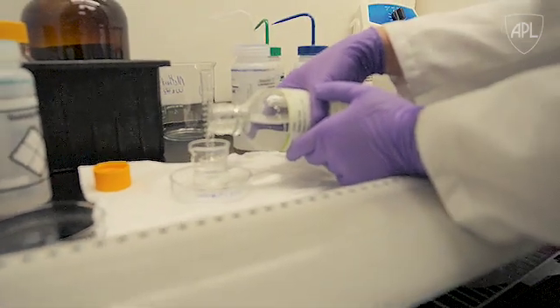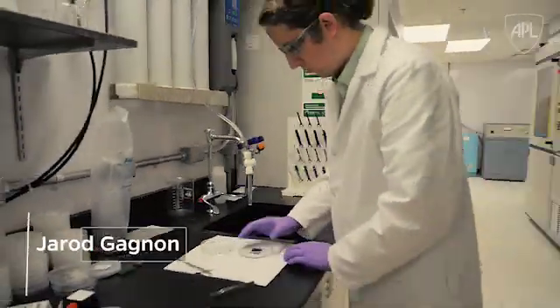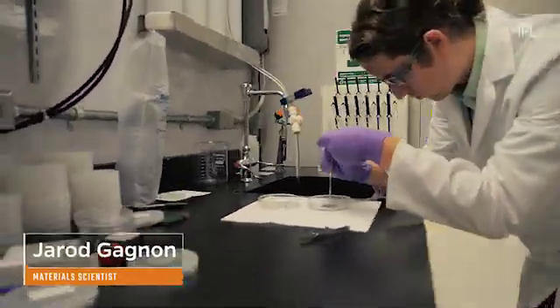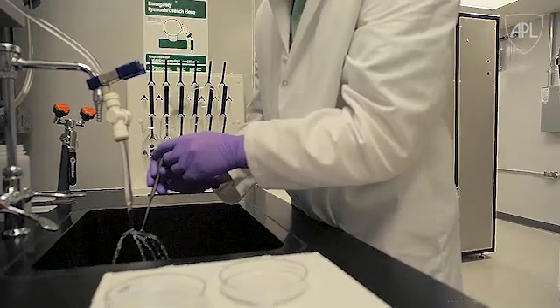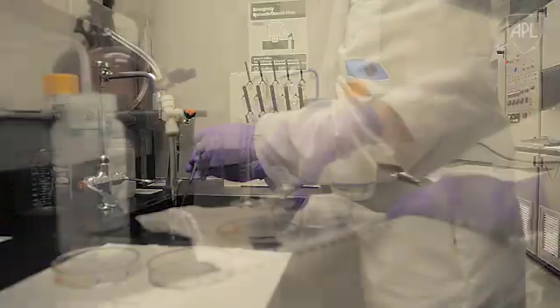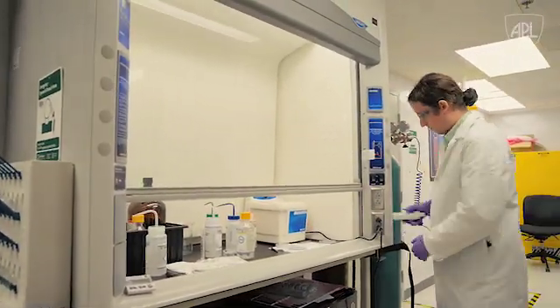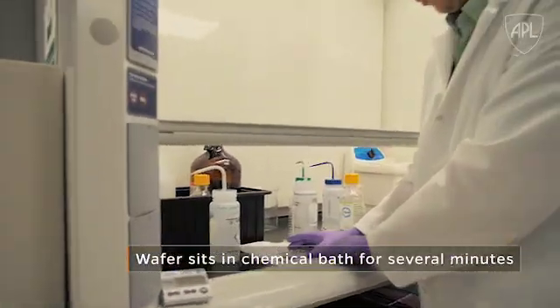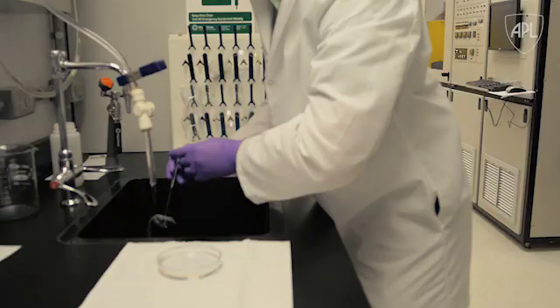For the epitaxy process, a surface treatment prior to growth is required. We start off with a chemical process where we clean the surface. When we start initialized growth on these surfaces, anything that breaks off — not clean — will disrupt the crystals that we're growing. So we take care in prepping our acids and solvents that we use throughout the cleaning process.